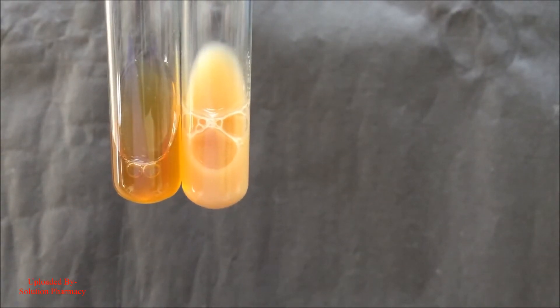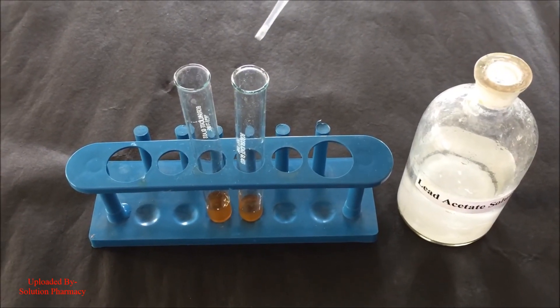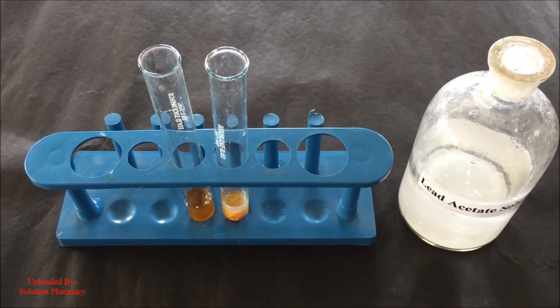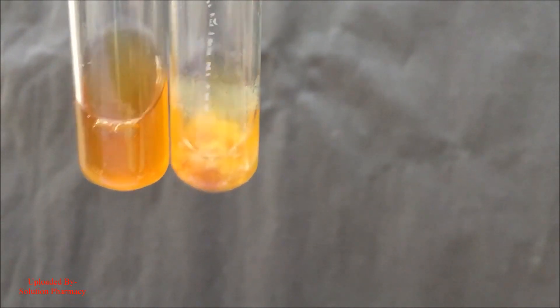Now we are going to perform the third test, that is the lead acetate test. Add few drops of lead acetate solution to the one test tube and compare the changes with the second test tube containing aqueous extract of the green tea leaves. Formation of white precipitate indicates the presence of tannin. You can clearly see the formation of white precipitate which indicates the presence of tannin in the extract. Thank you.